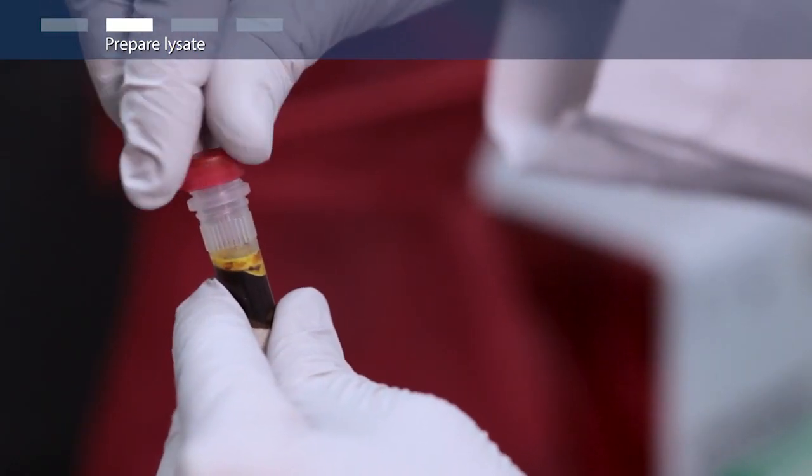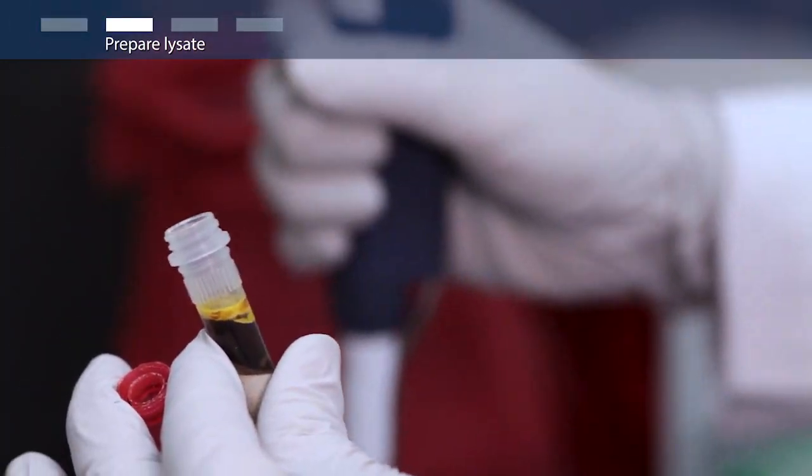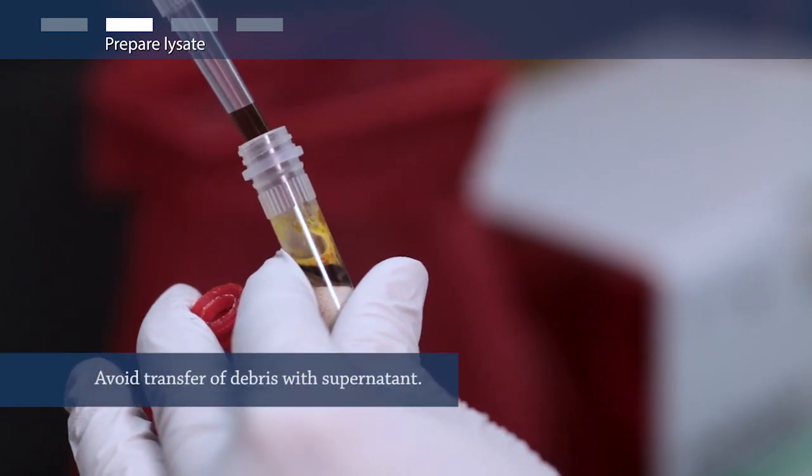Following a 5-minute centrifugation at 14,000 G, transfer up to 400 microliters of the supernatant to a clean microcentrifuge tube.